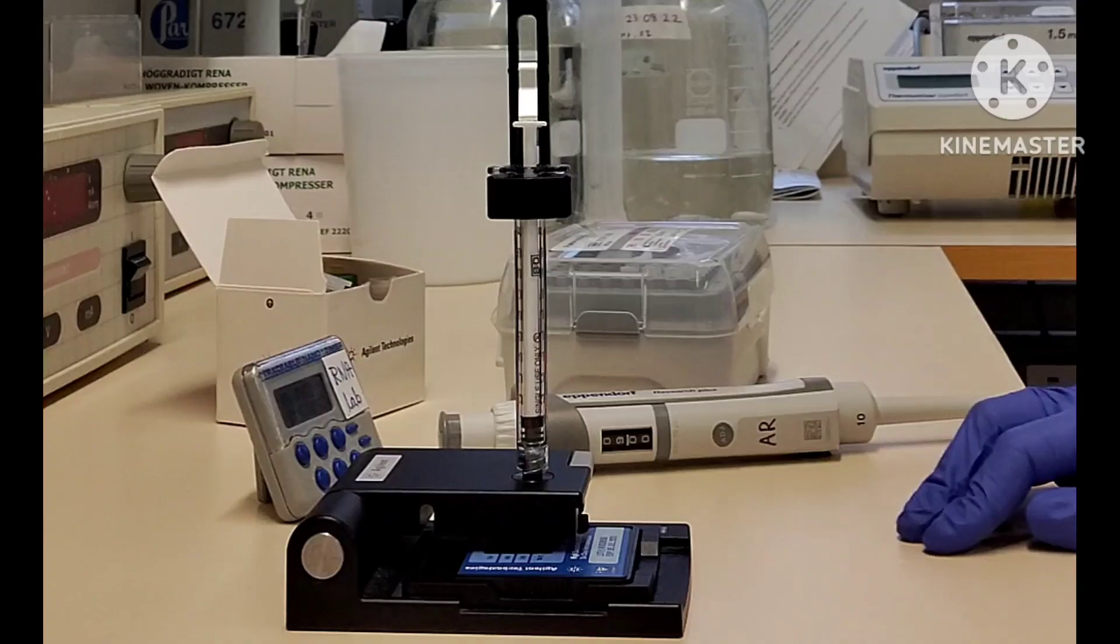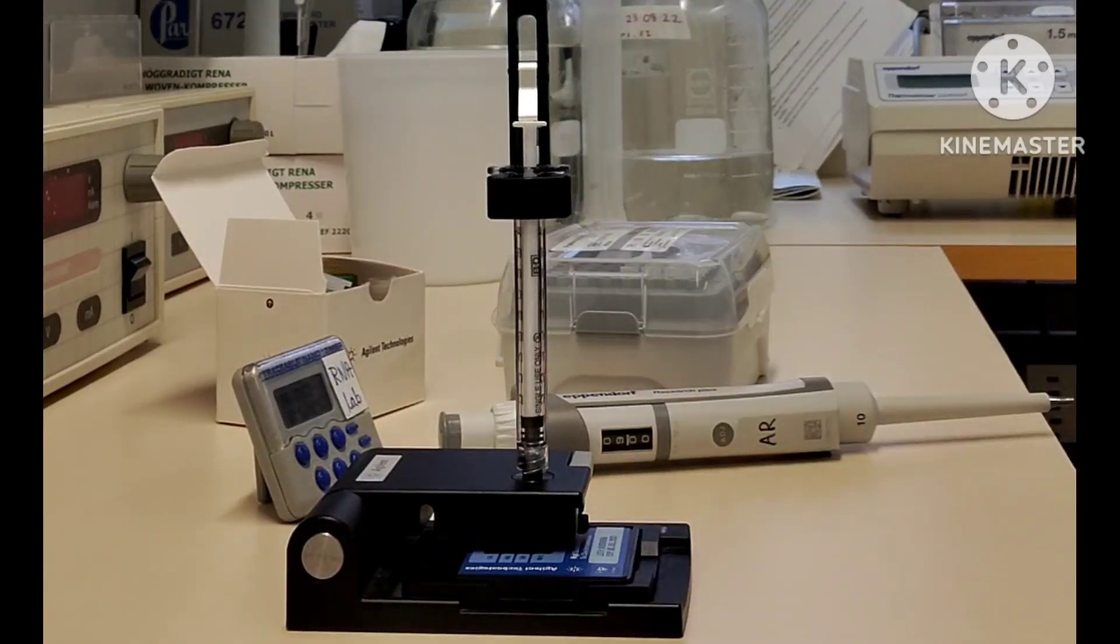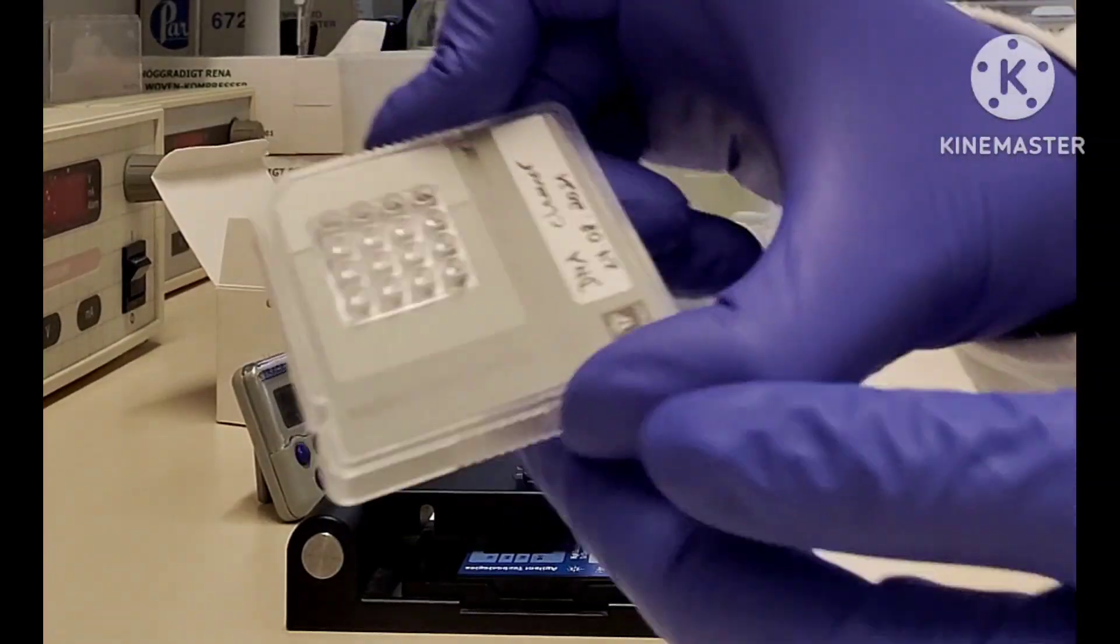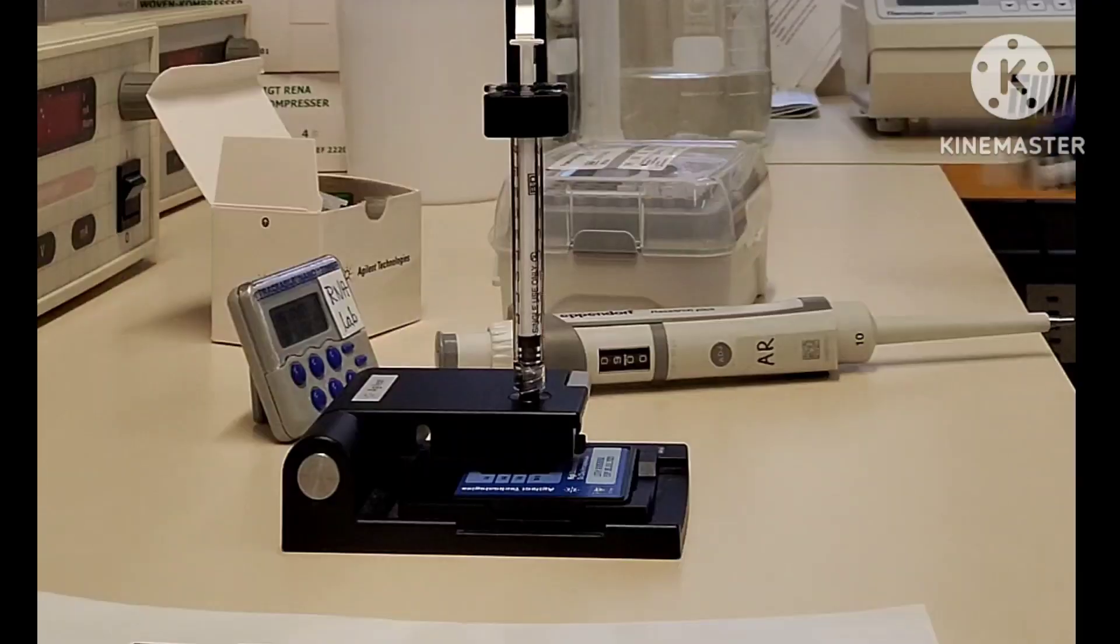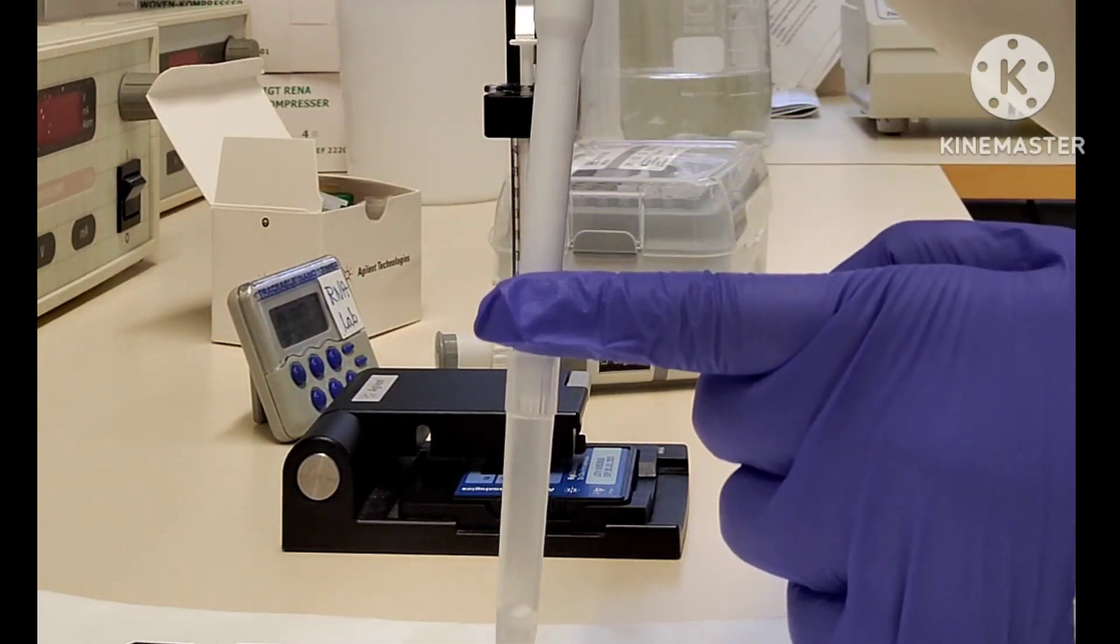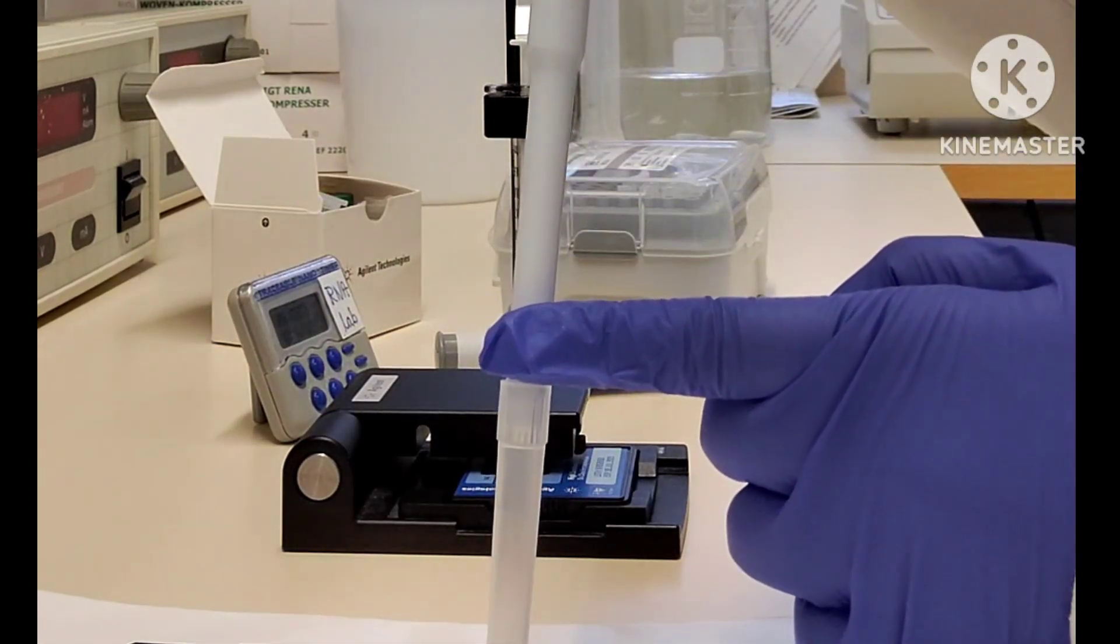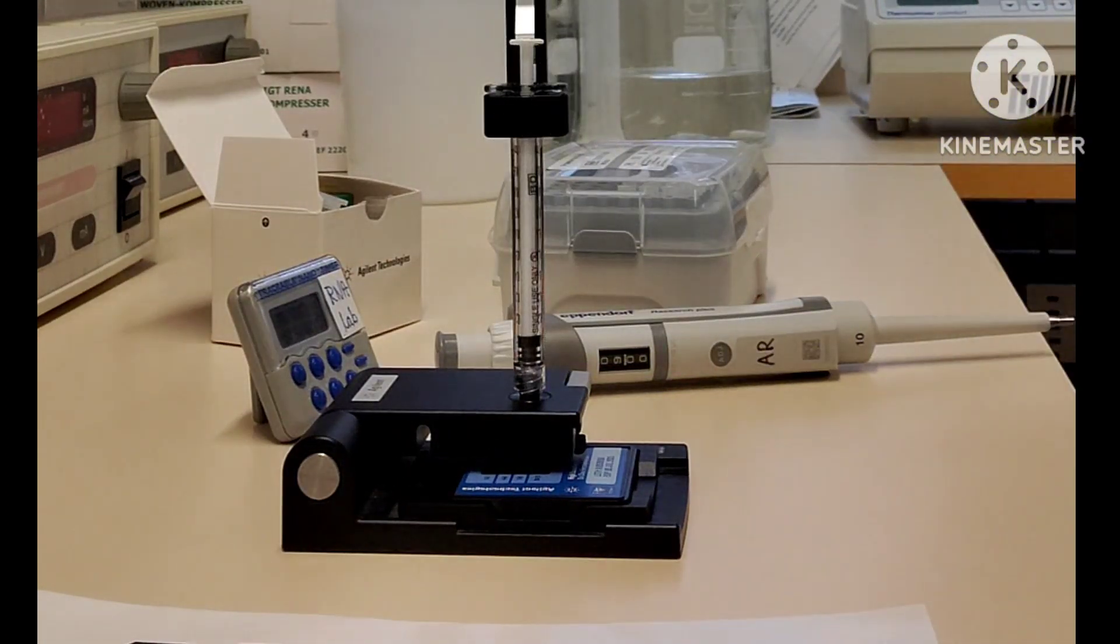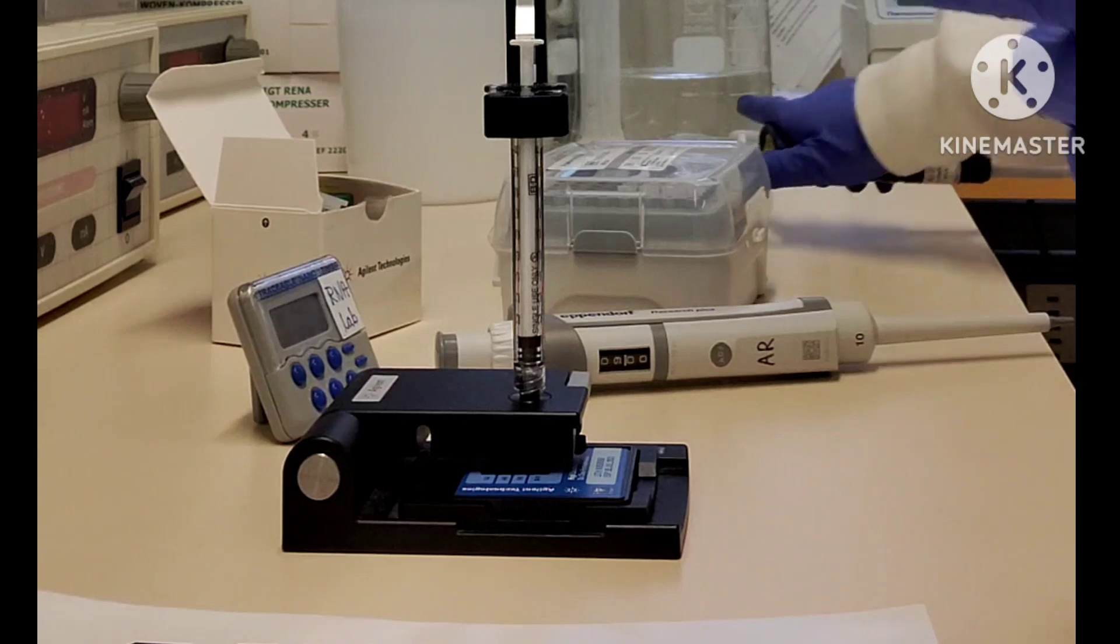In the meantime, you can clean the probe. For that, you can use the chip which is there in the kit and add 370 or 350 microliters of nuclease-free water.